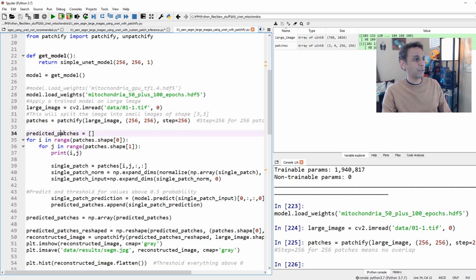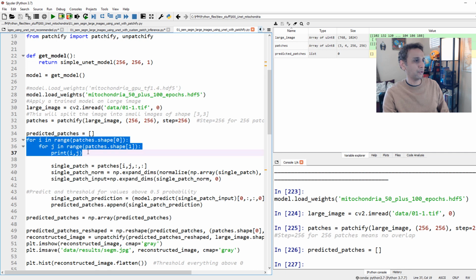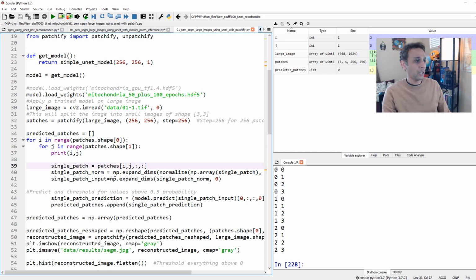Okay, so now I'm starting with my predicted patches as my empty list right there, which I'll populate in a minute. Same thing, go for i in range. For example, my 3 patches by 4 patches. First of all, just to show you, 3 patches by 4 patches, this should be 0, 0, 0, 1, 0, 2. This is very similar to the last one. I'm just showing you an existing library, that's it. And the rest of the stuff is exactly the same, okay?